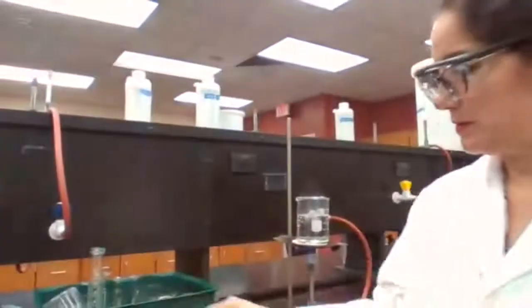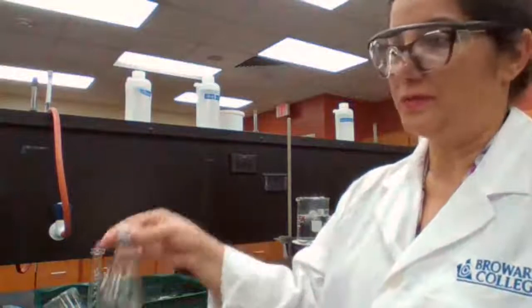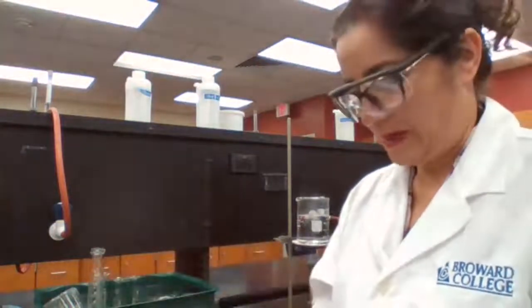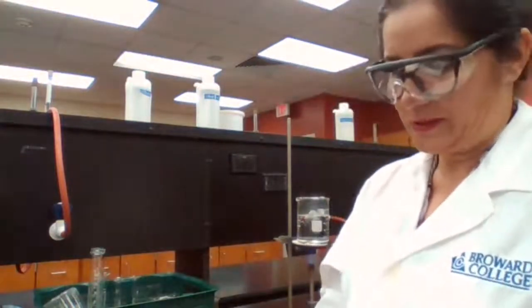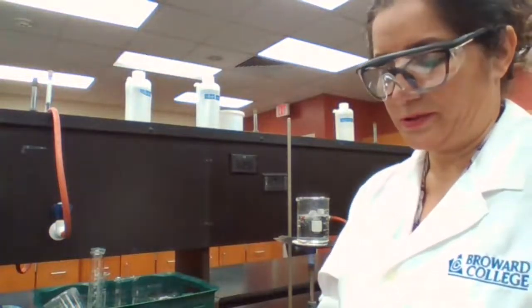It's better to reach room temperature before we measure the mass. We measure the mass of all the objects while they are at room temperature.